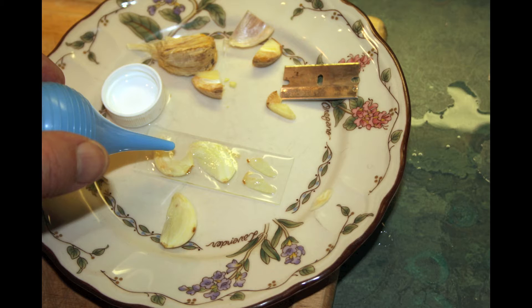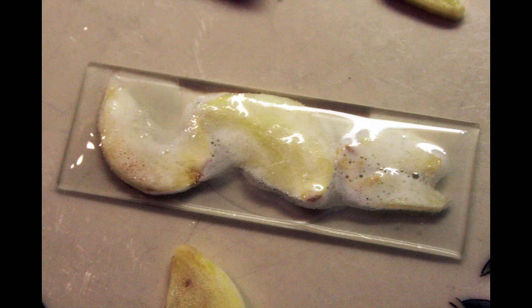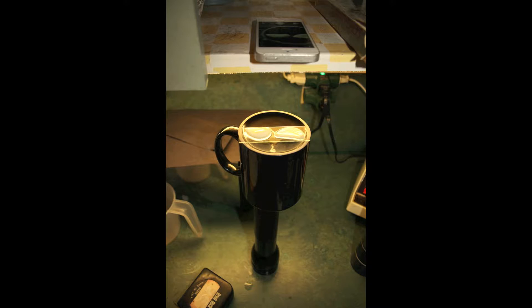I've tried it several different ways, and I've let it fizz up for about 10, 20, or 30 minutes before I bother to take it to my smartphone to get a closer look. Here's my setup for the smartphone: that's a black ceramic coffee mug upside down on a flashlight, about three inches beneath the lens of my smartphone, which is just sitting on a shelf there aimed downward. And there is a fluorescent light behind everything that kind of lights things up.